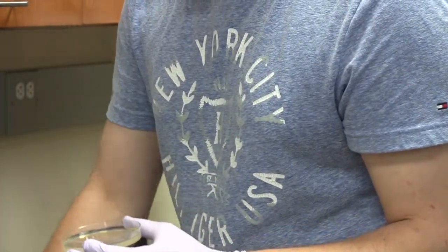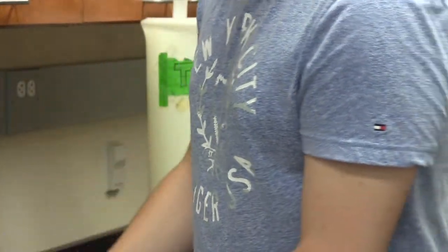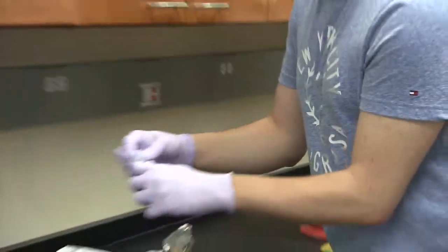And just dispose it into your labeled tube and close the lid, and it can shake in the incubator.